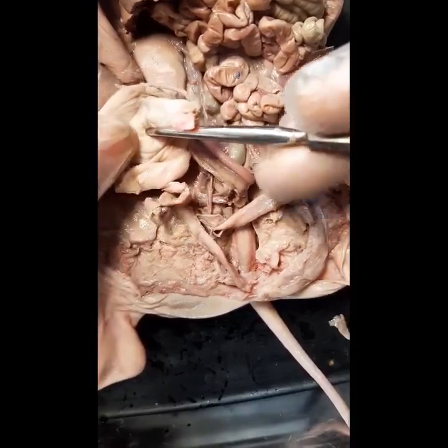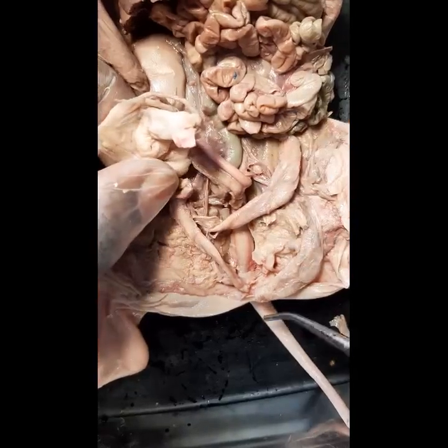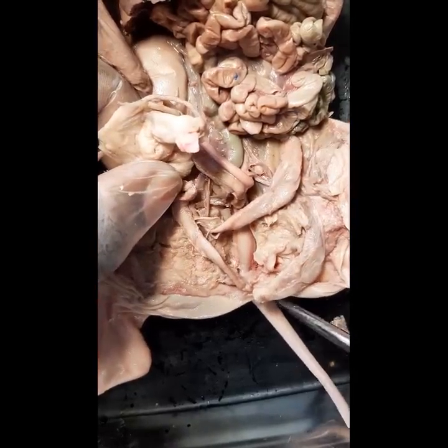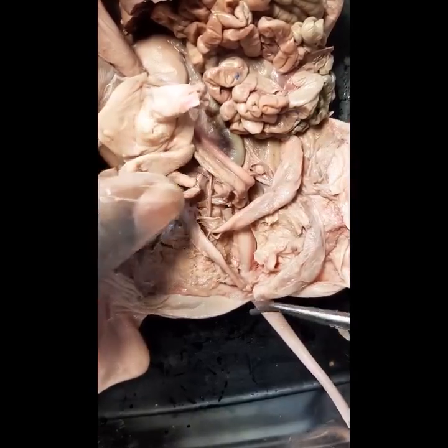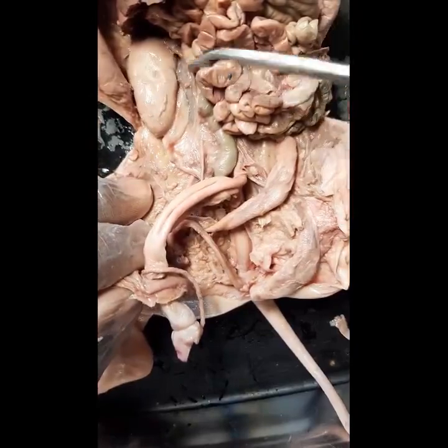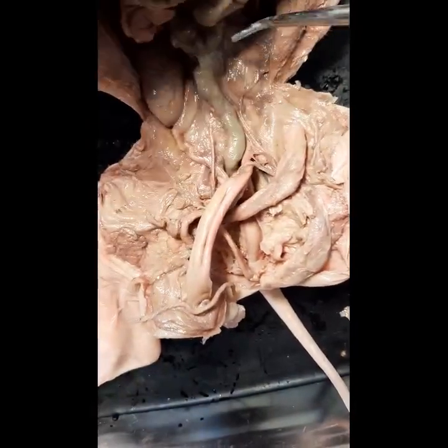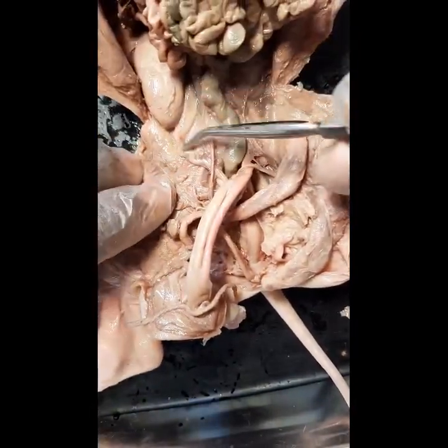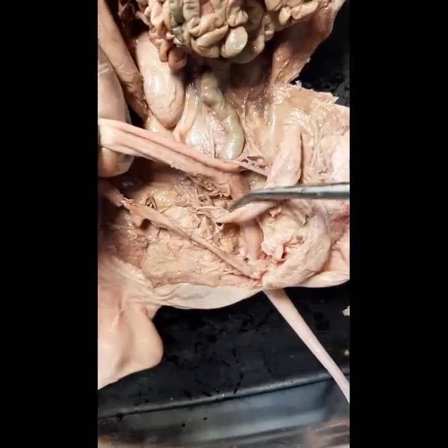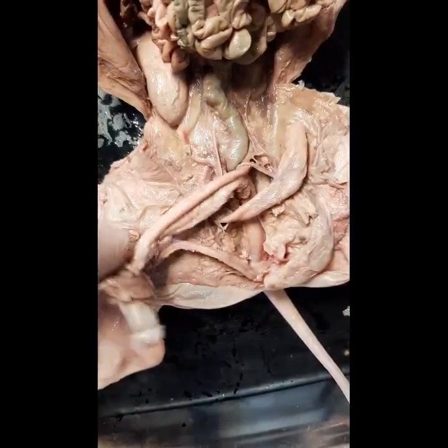Compared to female pigs, they have the urogenital opening and the anus posteriorly. So to summarize: kidneys — right and left kidney — ureter, the bladder, urethra, the penis, through the urogenital opening.